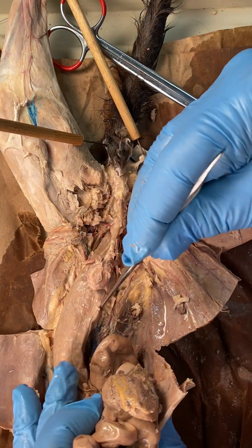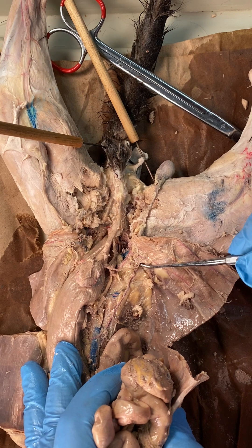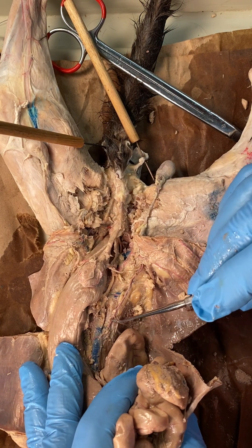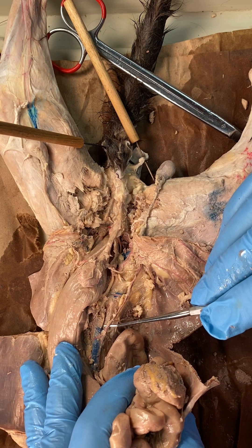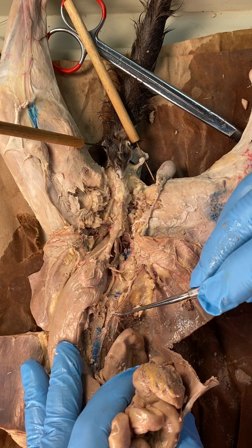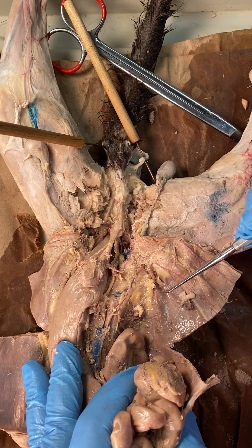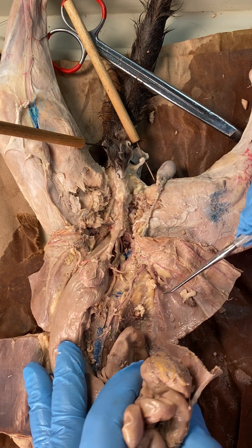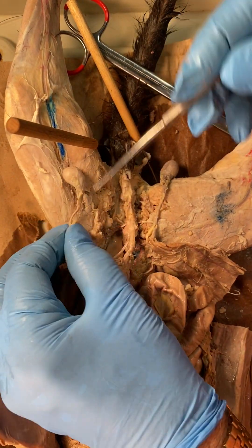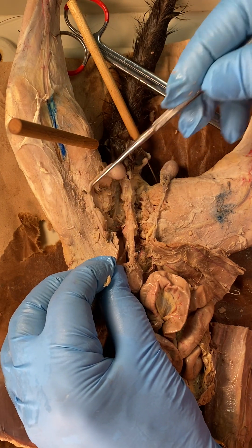If we follow that all the way up, the spermatic artery and vein came out right where the vas is, through the inguinal canal. Here is the right spermatic vein going into the inferior vena cava. The right spermatic arteries are going across, headed towards the abdominal aorta.